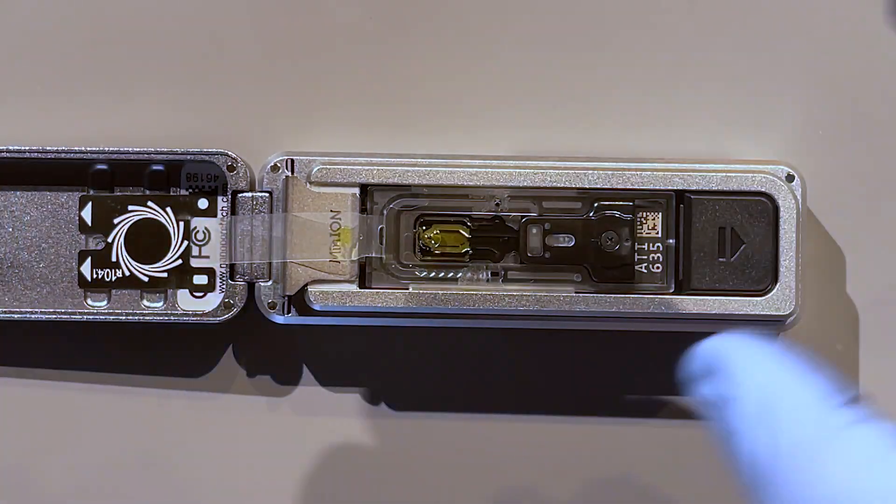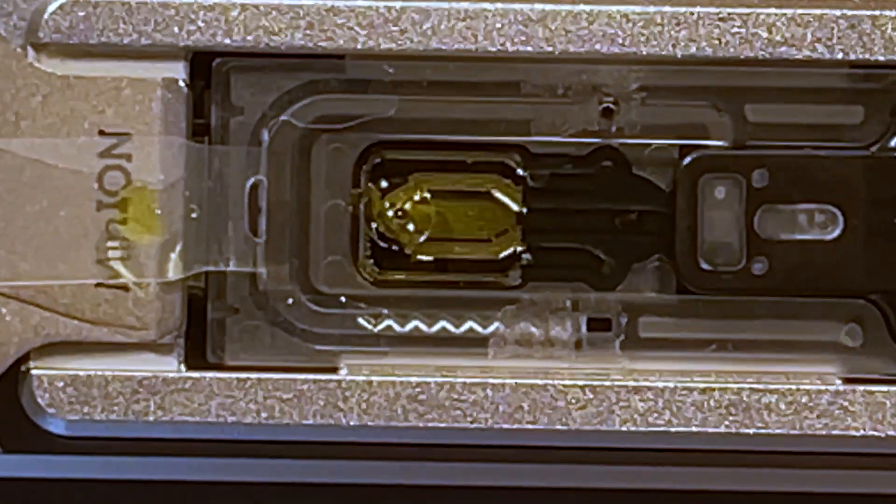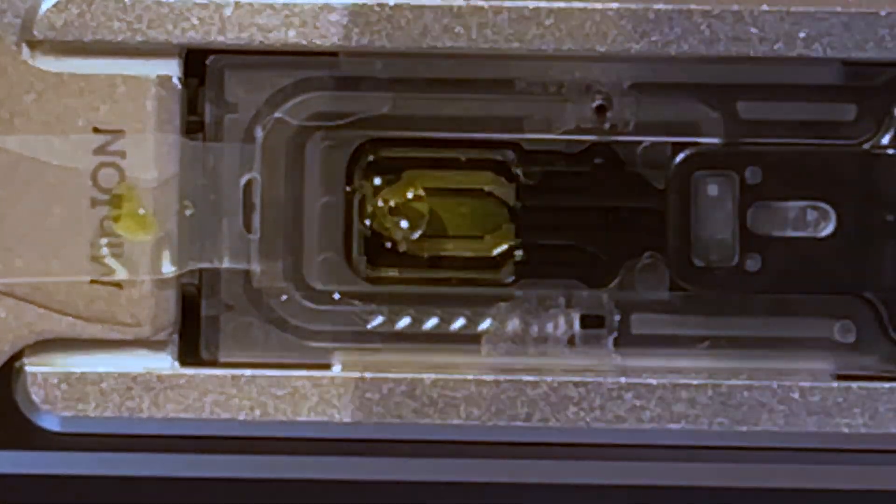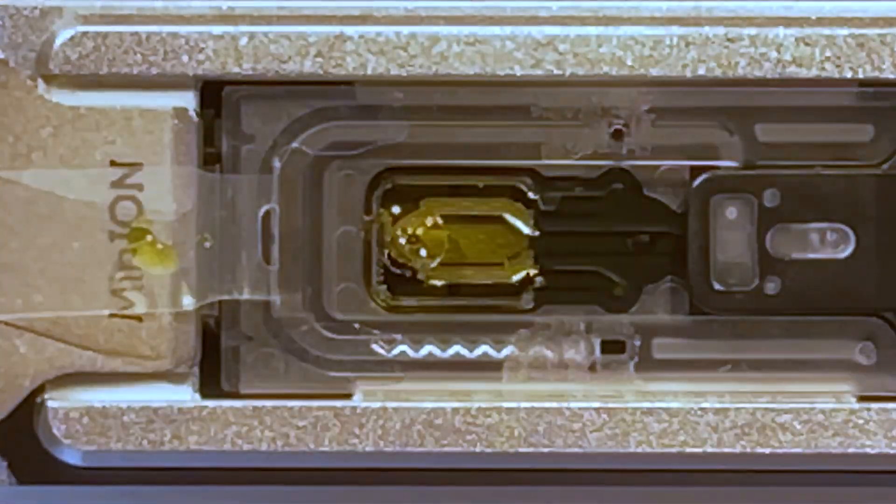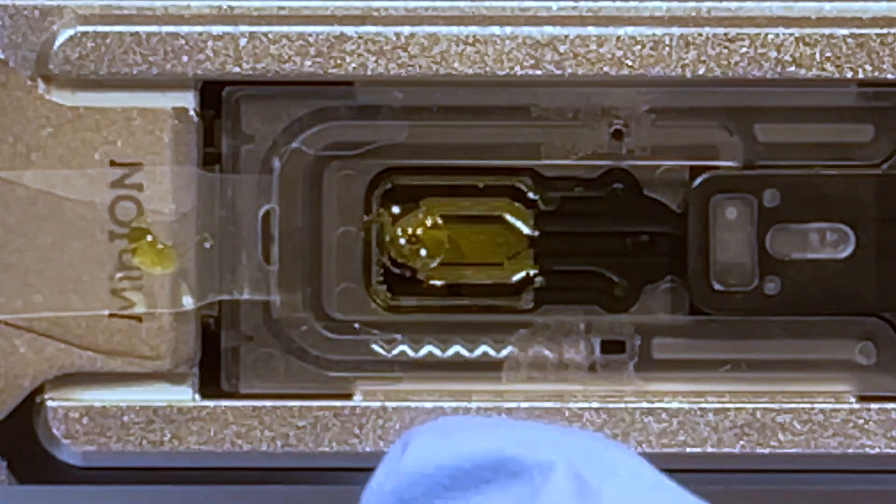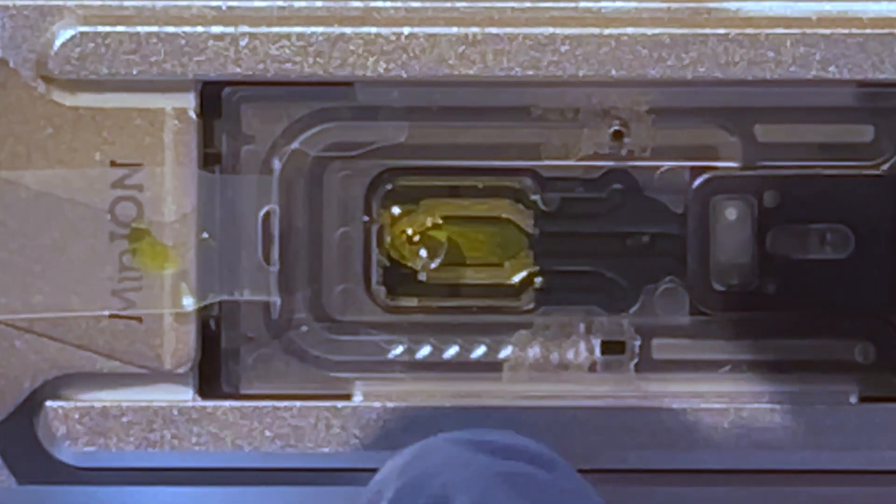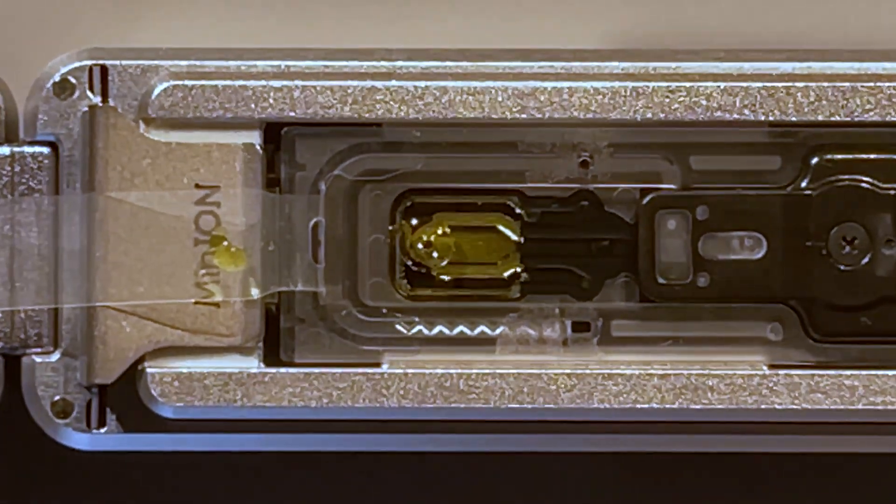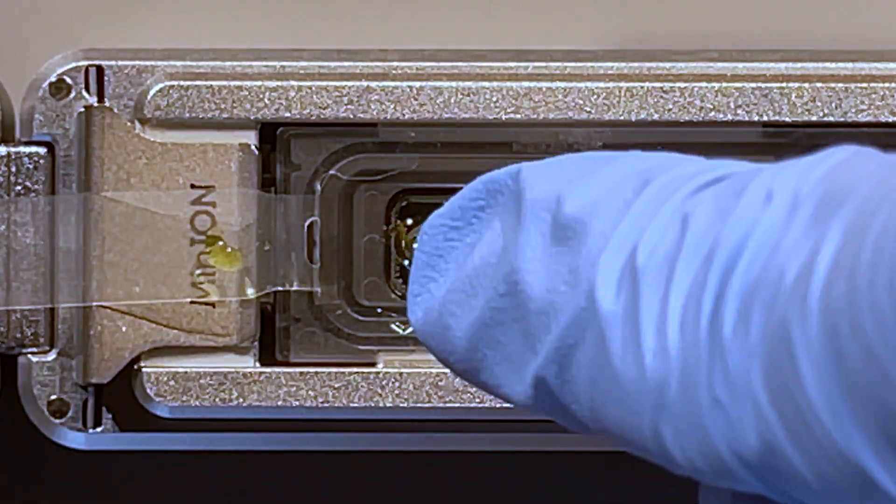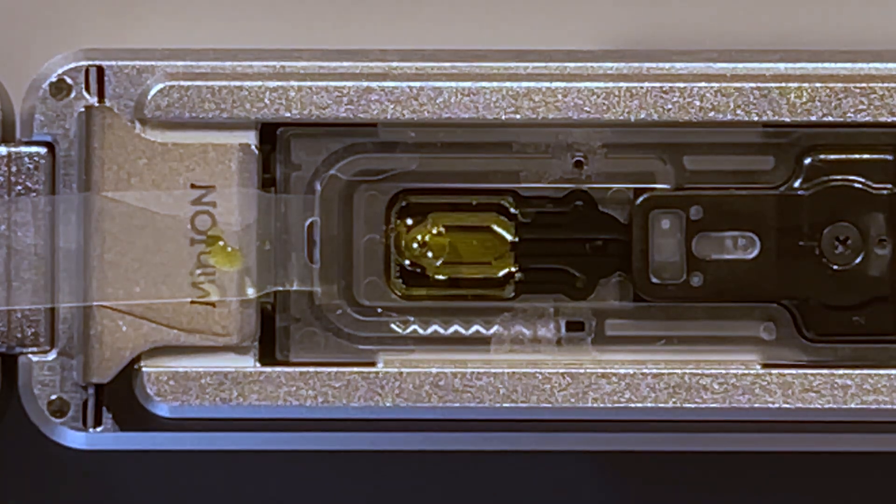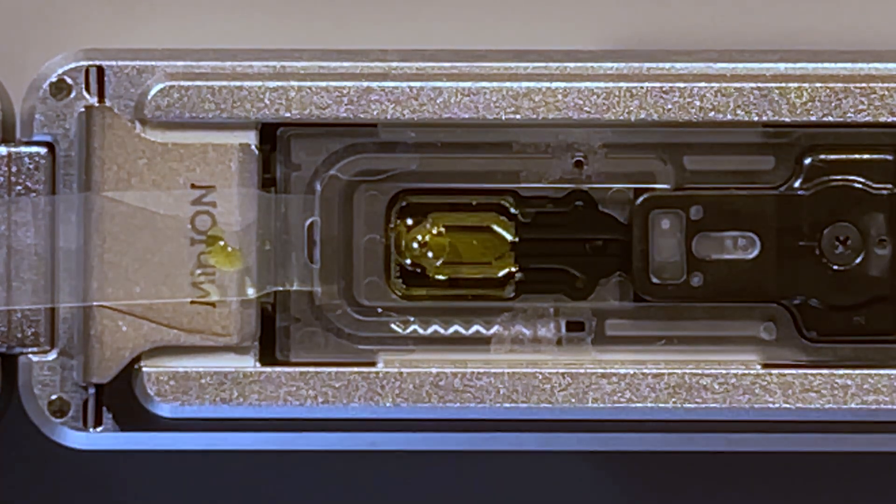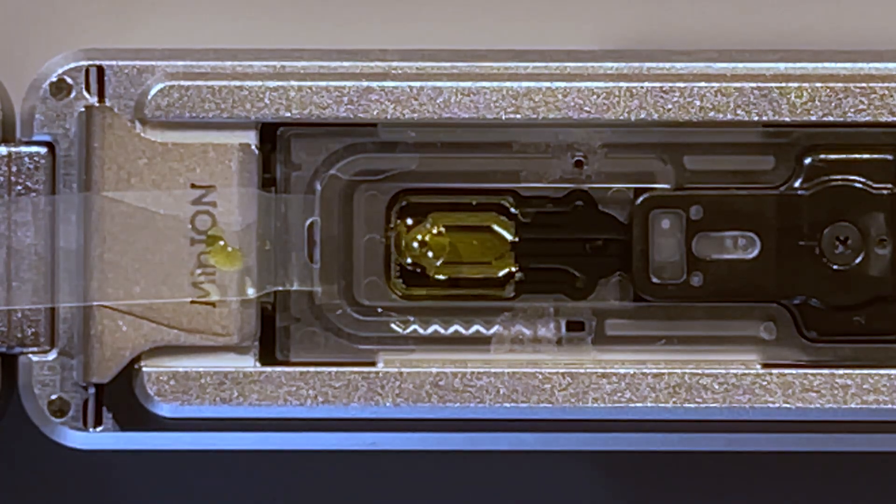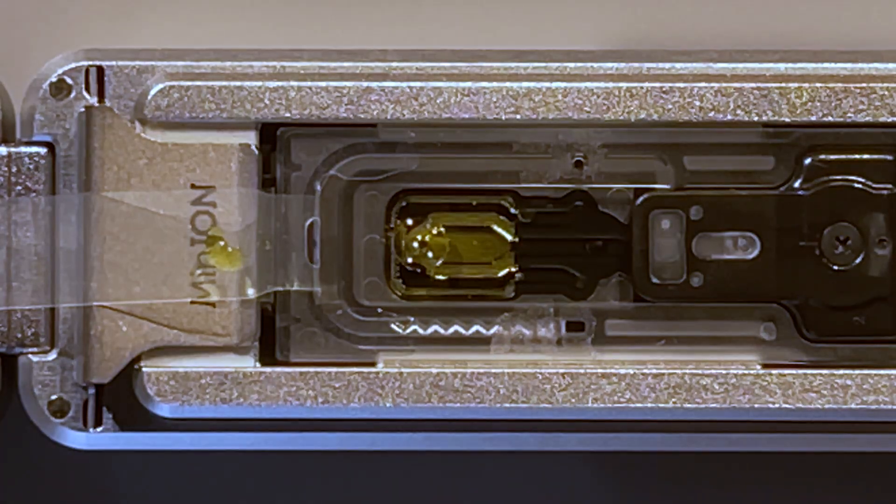And then after, you know, I pull it—pull it almost till it's over that flap. I can pull it up, and it sort of just pulls away. I can press from the bottom and just sort of temporarily stick it there. Okay, I'm going to show it a little bit. That glass window or that little window there with all the liquid in it is actually where the nanopores are in the device.